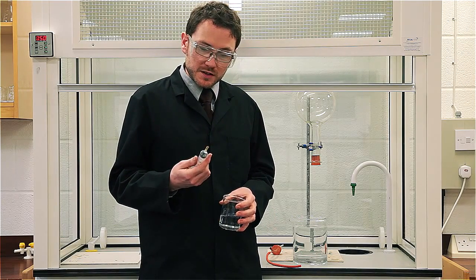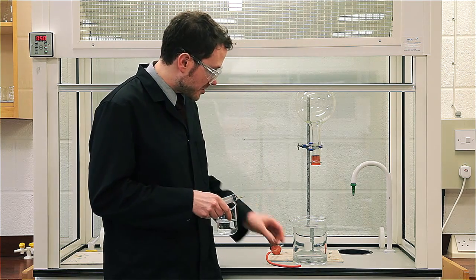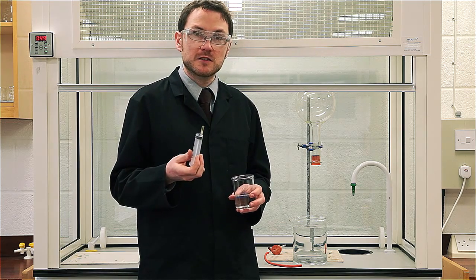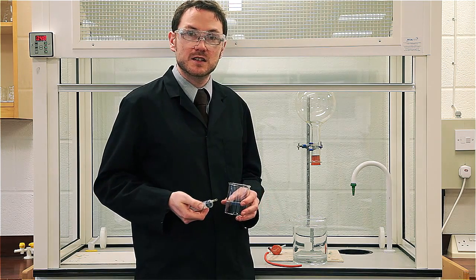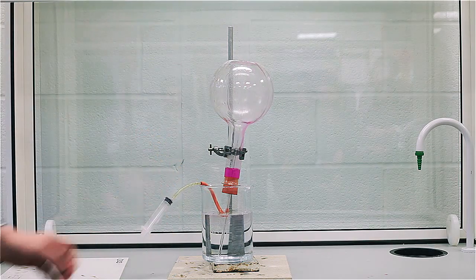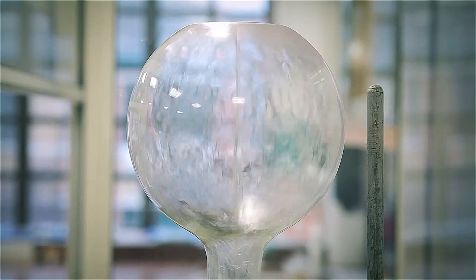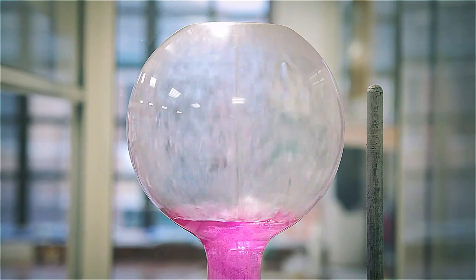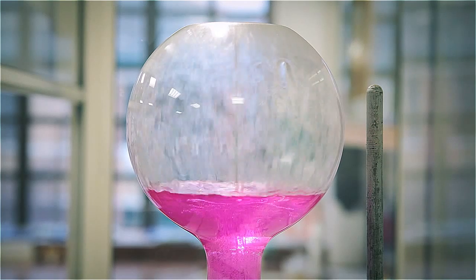We're ready to go. I've got a 20 ml syringe with a small piece of tubing on the end to ensure a good fit to the orange tubing on the delivery tubes, making sure no air can get in. I'm going to load this up, put it in the delivery tube, and inject the water, aiming to spray water up into the body of the flask. If it doesn't go first time, withdrawing some liquid and spraying again can help. As the ammonia dissolves in the water, the pressure in the flask drops, drawing up more liquid from below. The phenolphthalein indicator turns pink in the now alkaline solution.